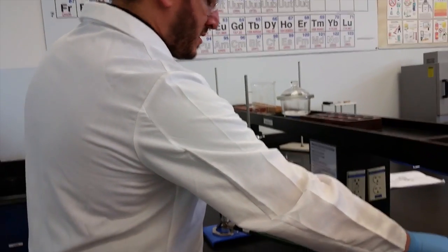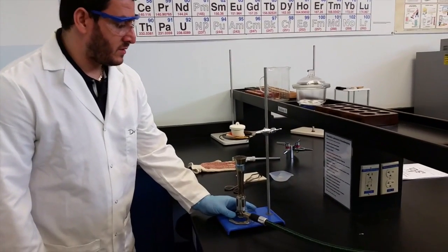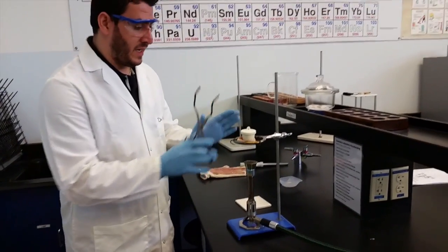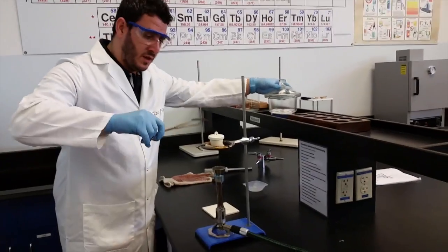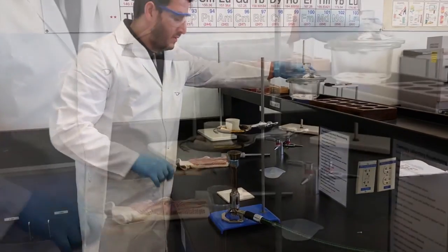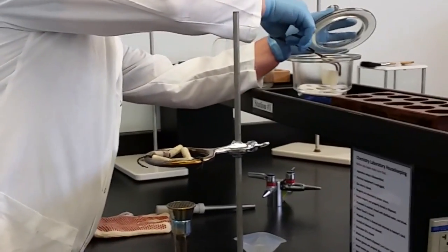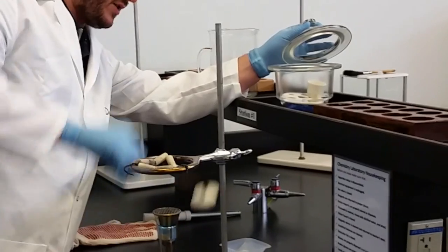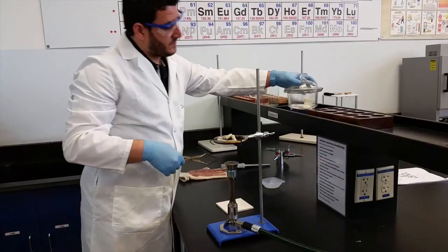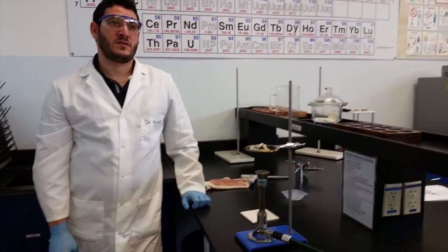Okay, now the 20 minutes is done. Turn off your burner. It's very hot - you don't want to touch anything with your bare hands, so don't forget to use the tongs. You first put your lid on the tile, take carefully your crucible, put it in the desiccator - you don't cover it. Put also the lid in the desiccator but you don't cover it. You will wait around five minutes till it cools.